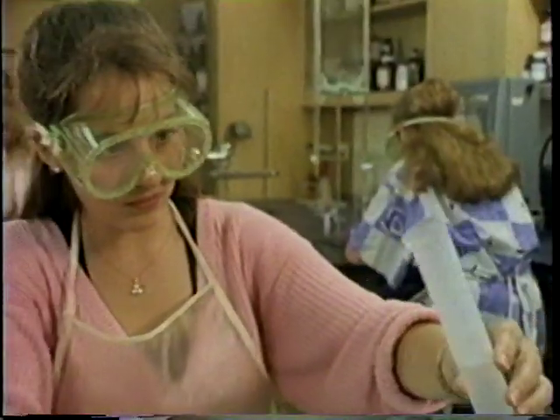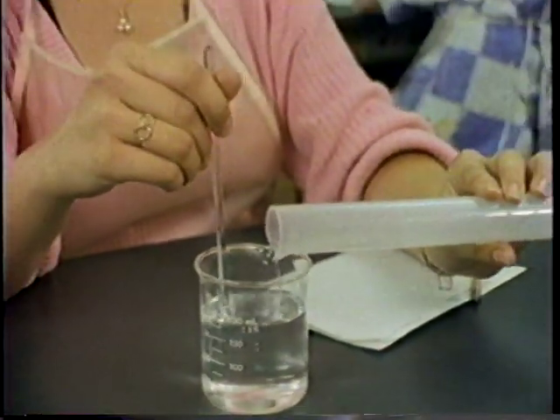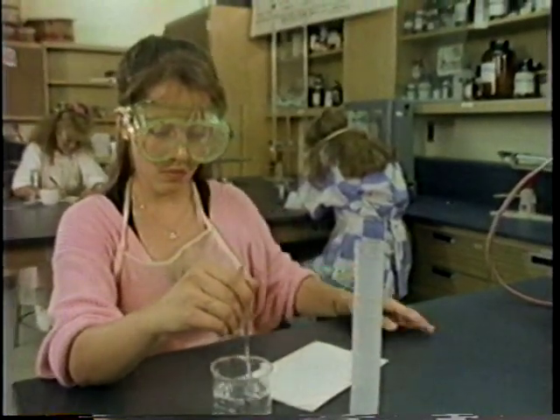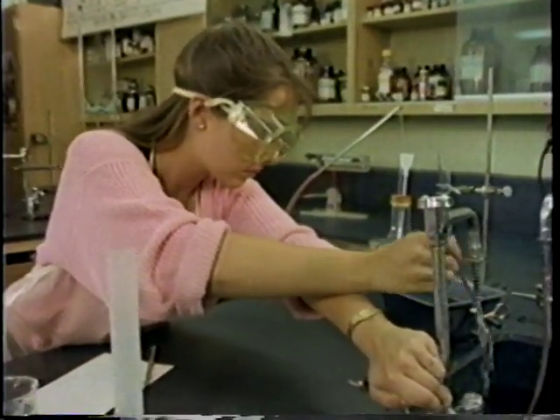Well, let's see. First, I had to dilute the acid. How'd you do that? Very carefully. Acid should only be diluted by pouring it into water. Never water into acid. Why is that? It'll mix better that way, with less chance of it splashing in your face. I poured the acid slowly, stirring at the same time. Then I rinsed the stirring rod in water and placed it on the bench.